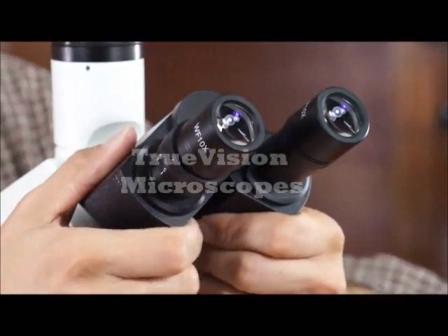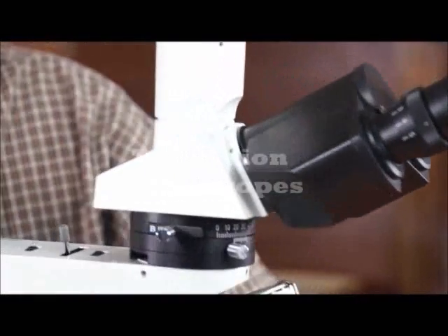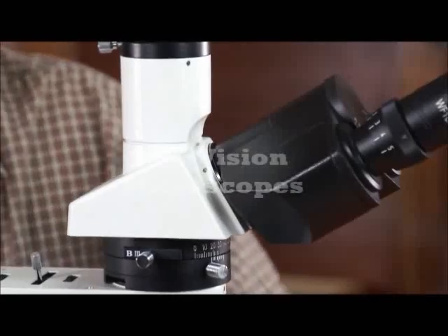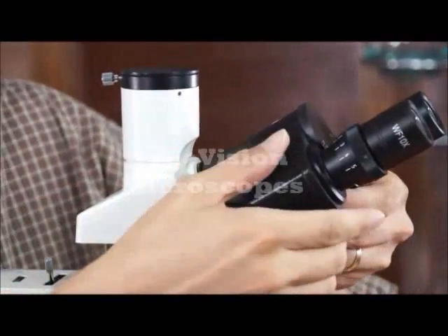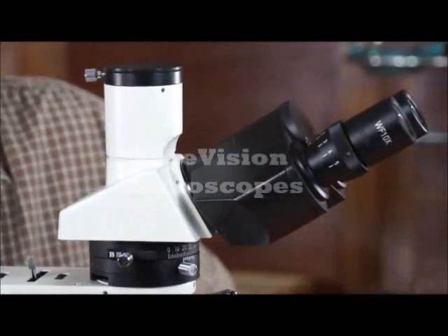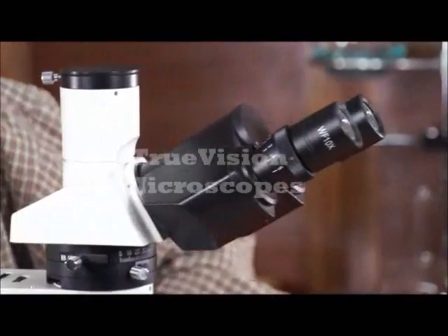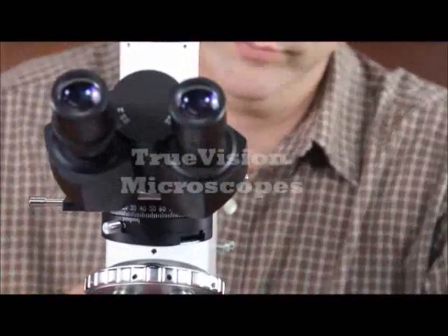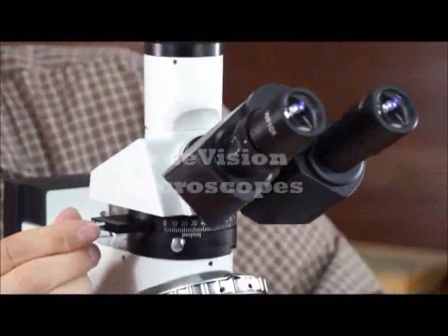The head is on a convenient ergonomic 30 degree angle, which is easier to view than on a 45 degree angle. This microscope has a Bertrand lens — this is the Bertrand lens.